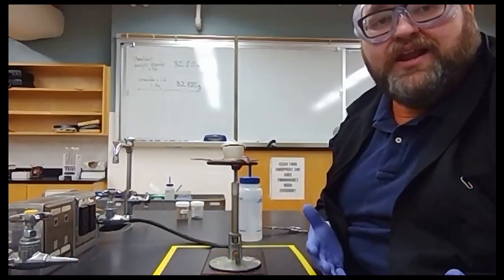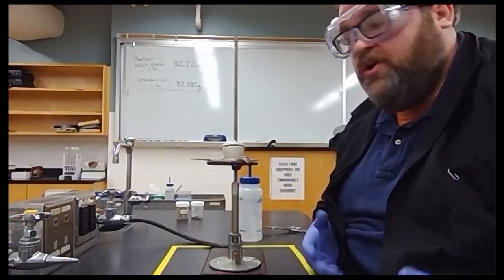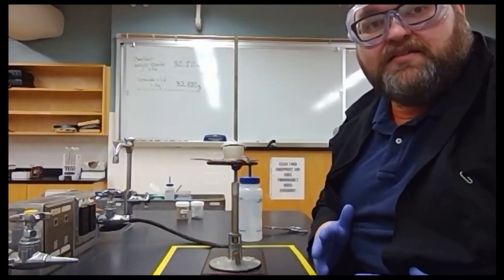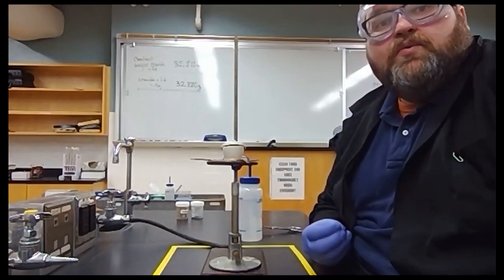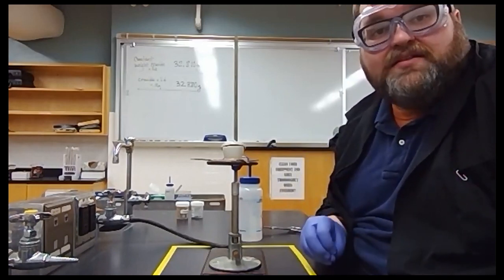This time we're just going to have to time it. There's no visual indicator that the reaction is over. So we're going to heat this intensely for another 10 minutes. During that 10 minutes, that magnesium nitride to hydroxide to oxide reaction is going to happen. When that's over, we now have our final product and we're ready to obtain its mass.